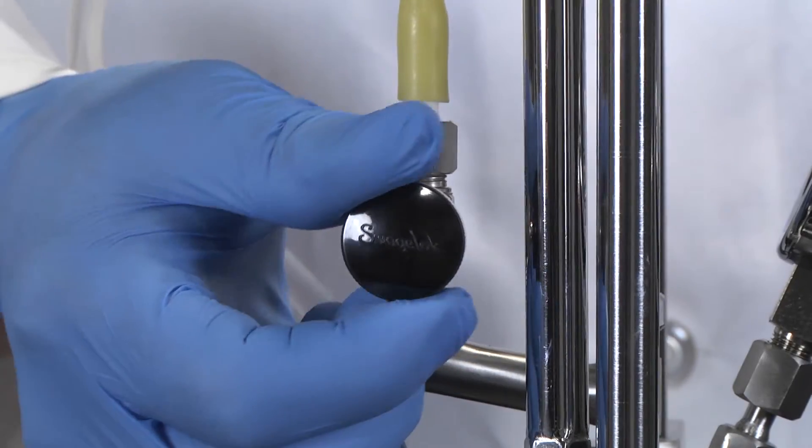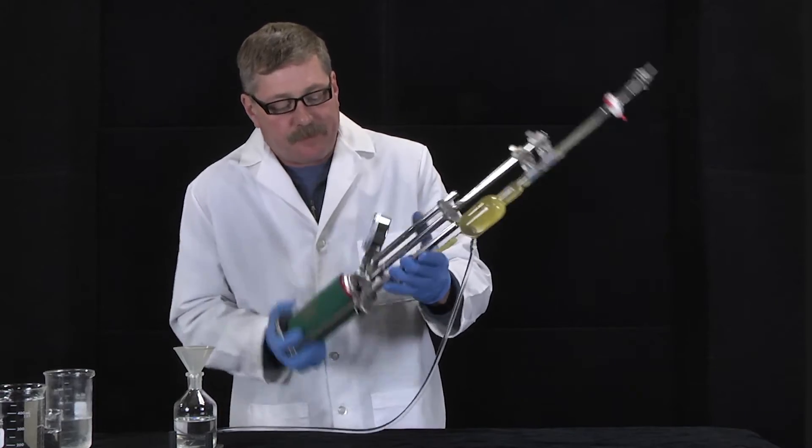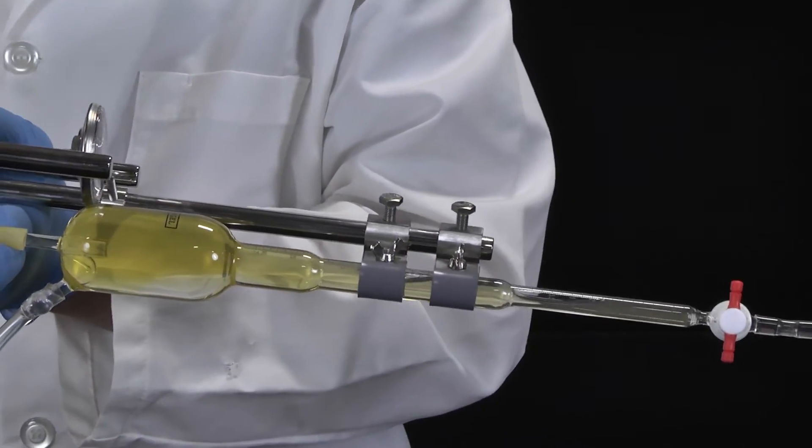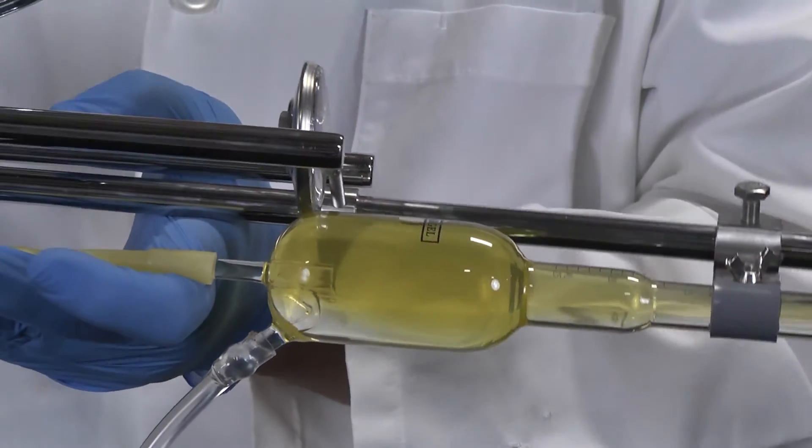Close the whitey valve. Shake the instrument a few times to allow absorption of CO2 gas by the caustic solution. Invert the instrument and allow the gas that was released into the burette to be absorbed in the larger bottom bulb of the burette.